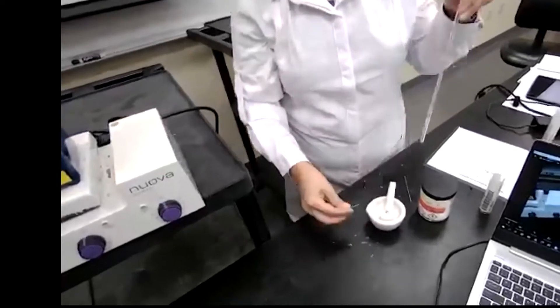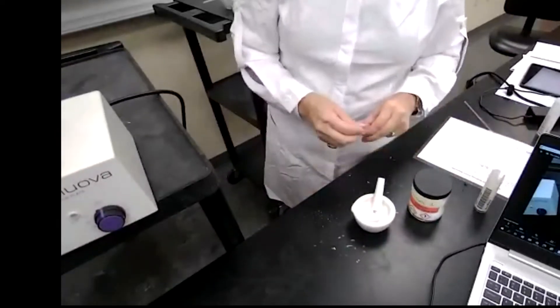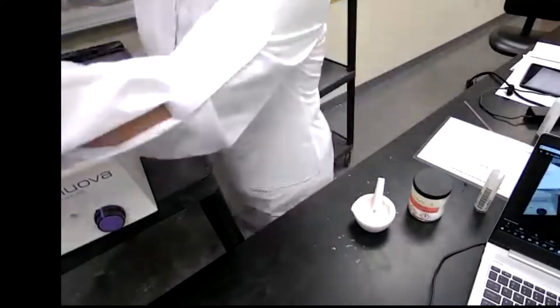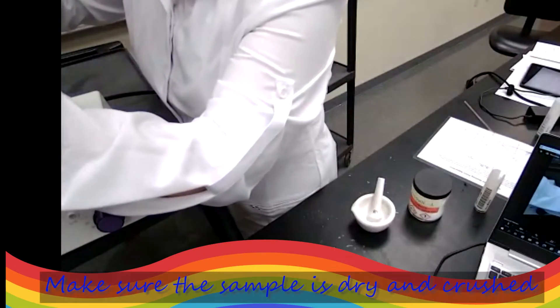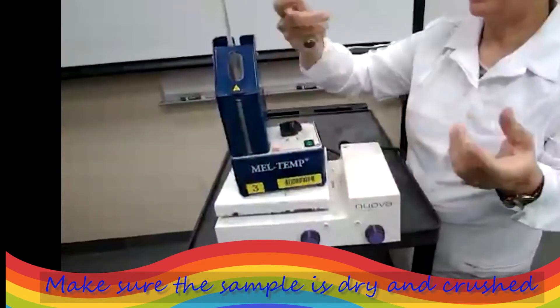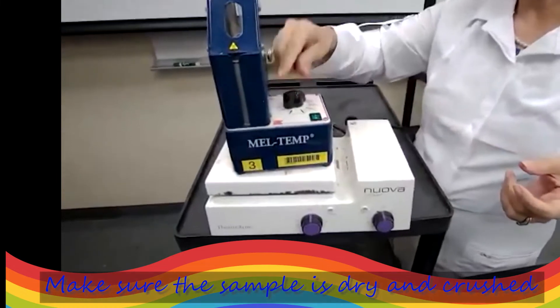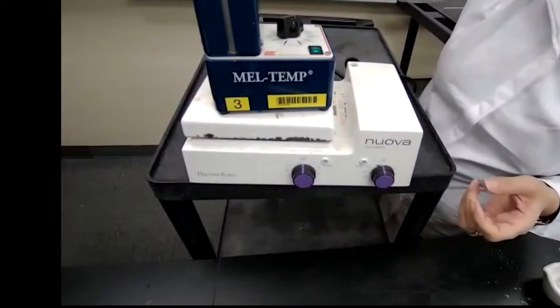And as soon as I have approximate melting point for the sample, then I can adjust the power regulator and more proper setting for my actual sample. So I'm going to place the sample into the sample holder, turn it on, and set it at like six this time for faster heating. That's what the quick sample is going to do for me.